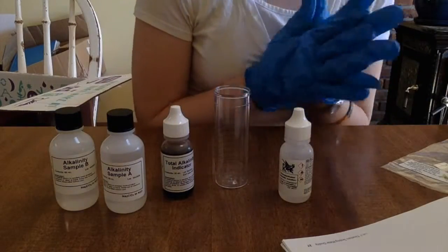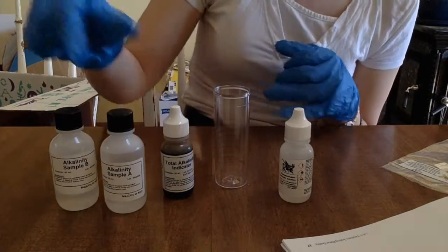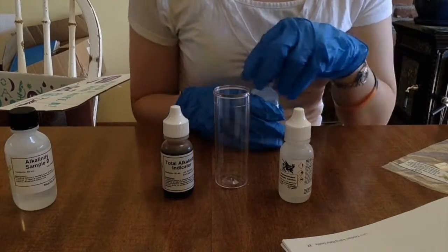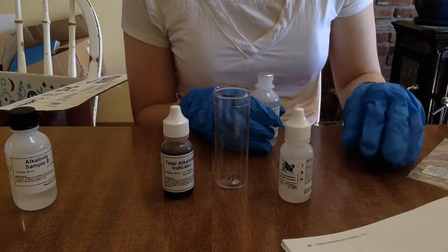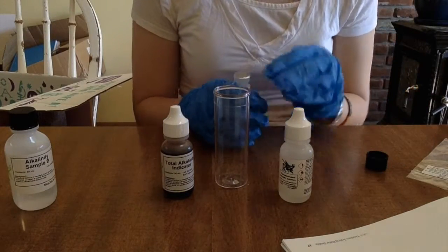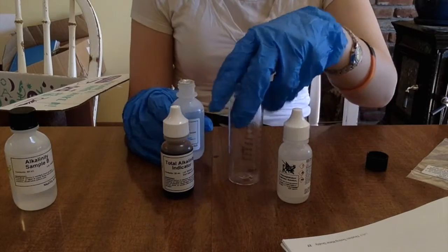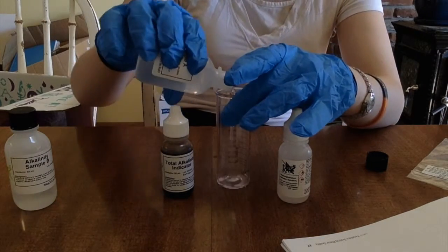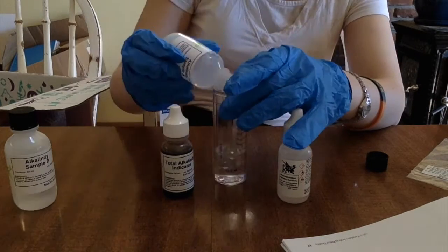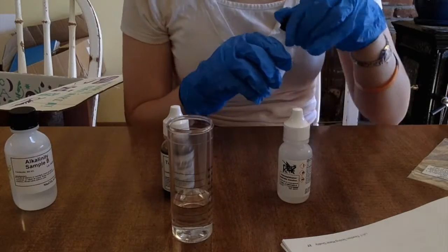So the first step is water sample A, which would be this one. Gotta fill it up to 25ml. I need to get this up to 25ml. And right about there. Put this lid back on.